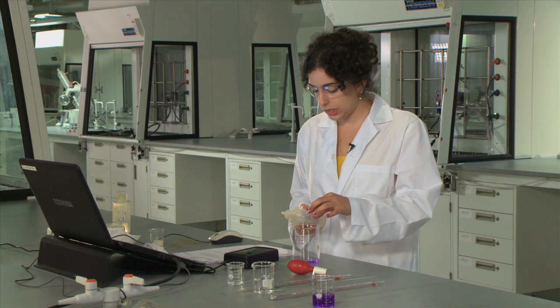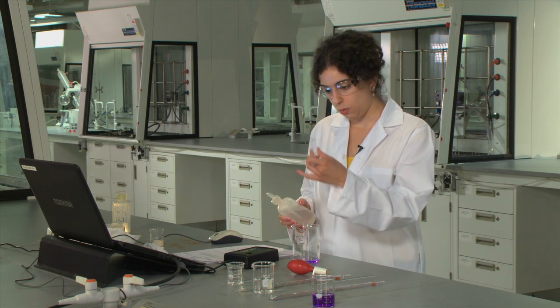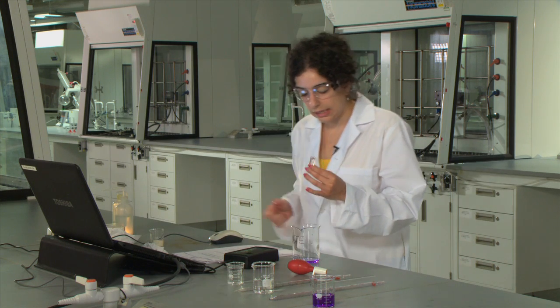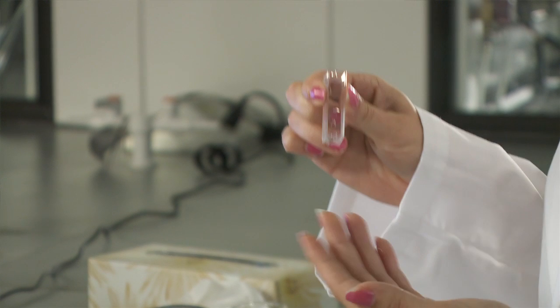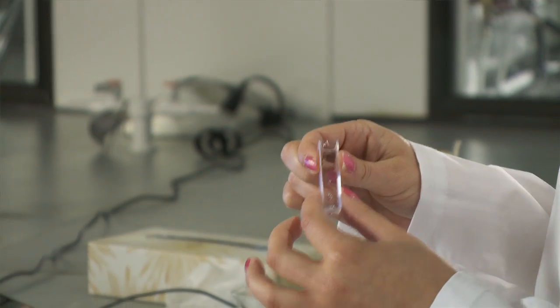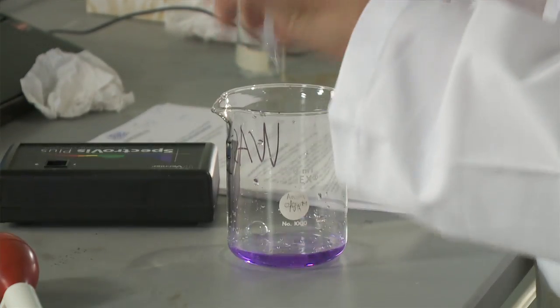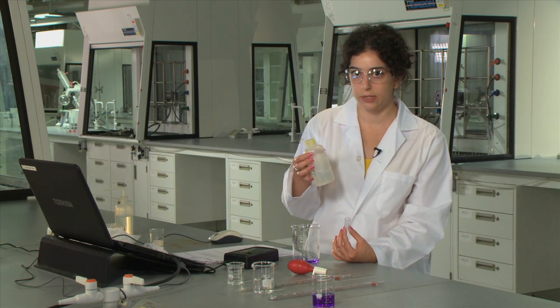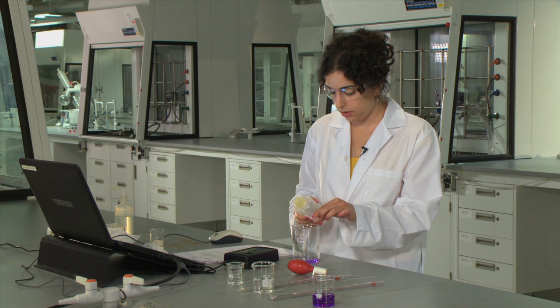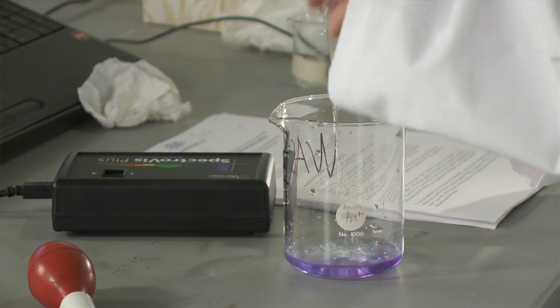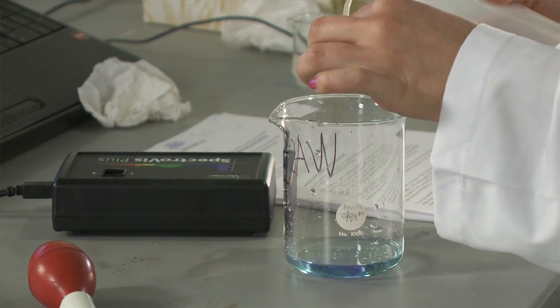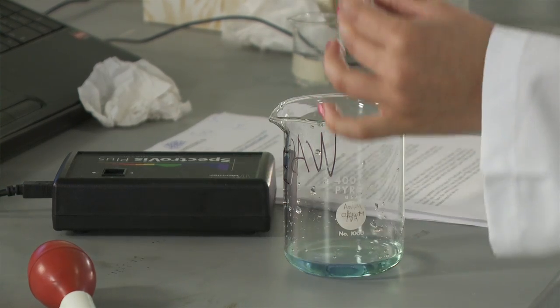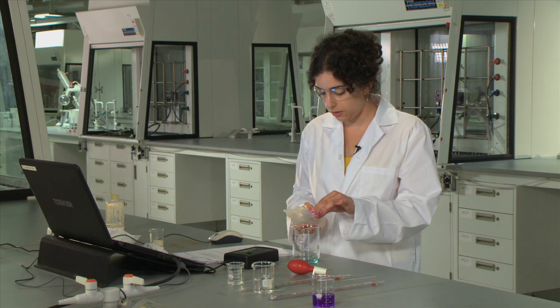Now sometimes what happens is once in a while, we'll get a little bit of purple showing up in our cuvette. Often what can happen is that the crystal violet will stick to the cuvette. And if that's the case, you can go and ask your TA for a solution of one molar hydrochloric acid and give that a quick rinse. This will remove any trace amount of crystal violet left over in your cuvette. So you just want to rinse it a couple of times. Then make sure that you rinse out the acid with some distilled water.